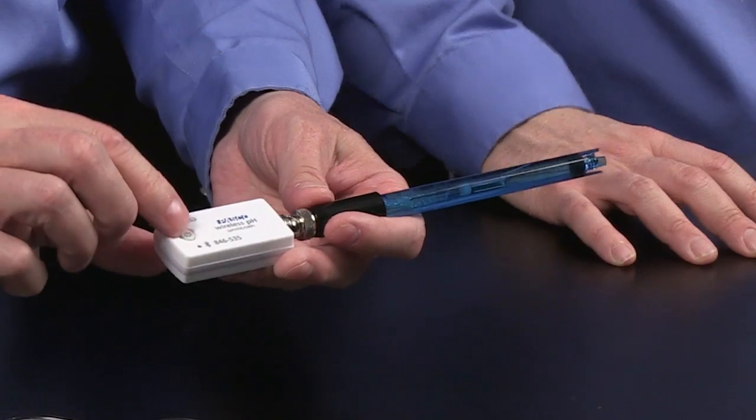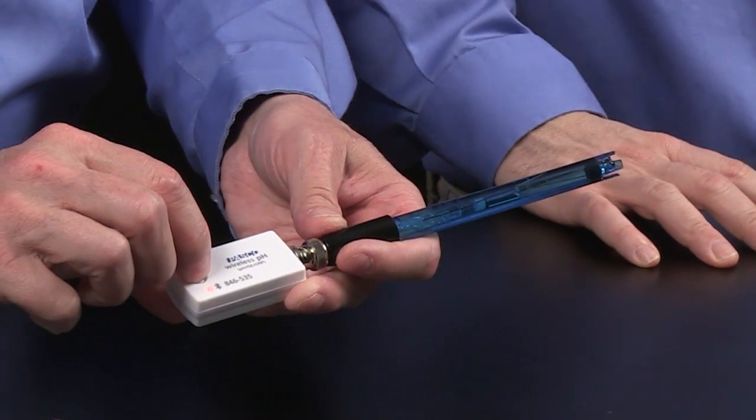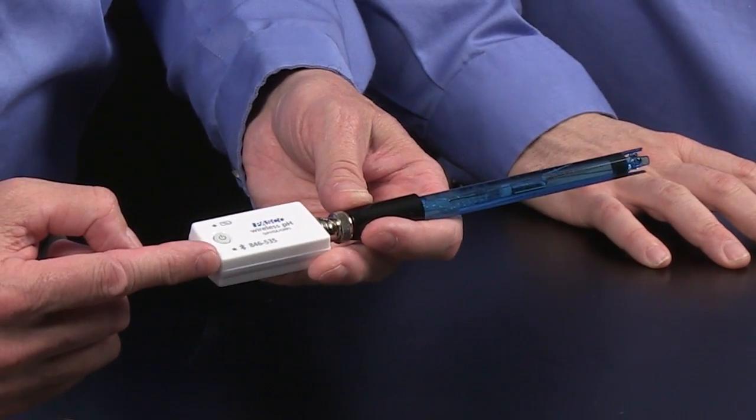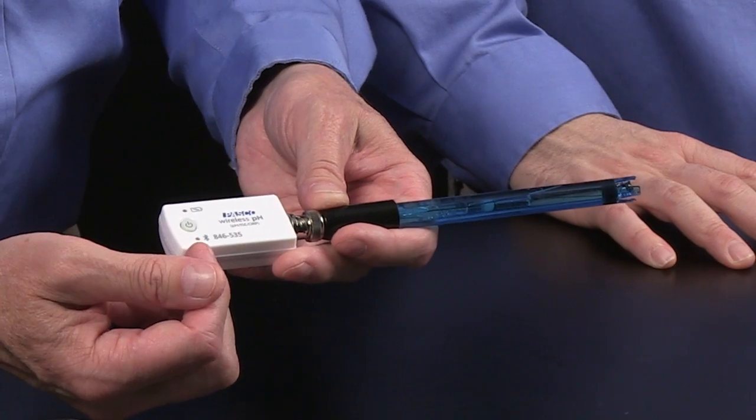To further prepare it, I'm going to turn it on. It's just a matter of holding down the Start button just for a moment. Then I notice it starts to blink red by the Bluetooth icon and the ID number.